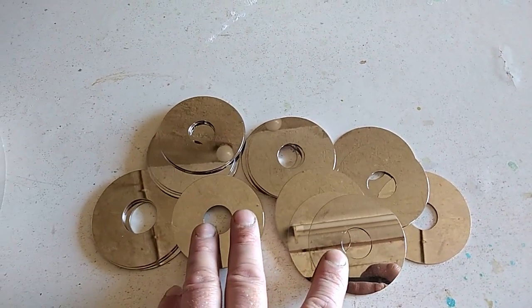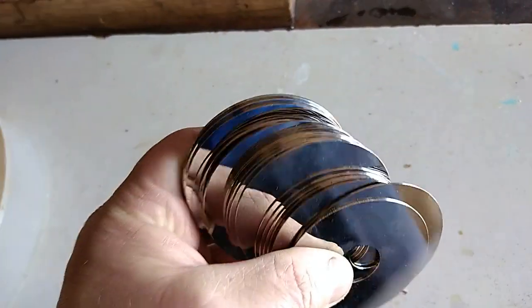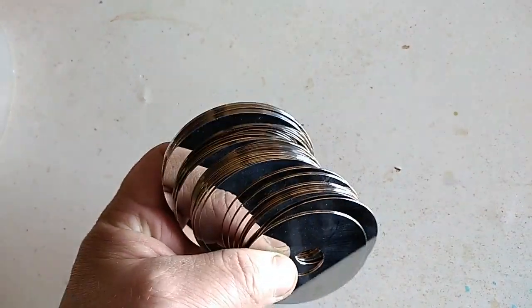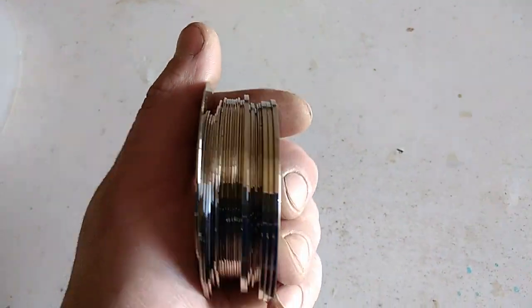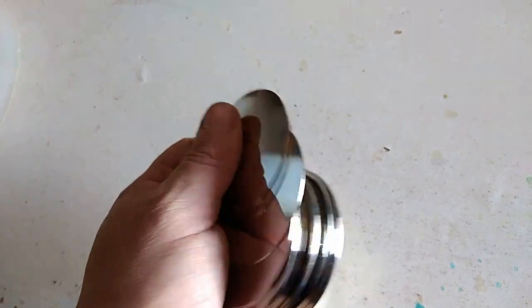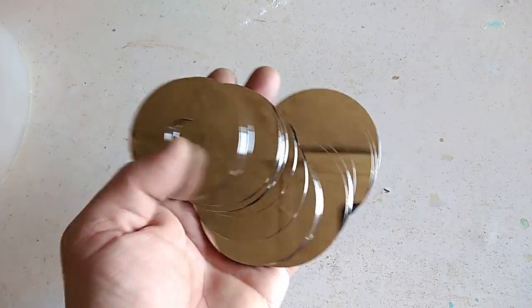I'll add some nitric acid first. So here I have 25 pieces of laptop hard drive plates. Three or four of them are thicker, so those are probably aluminum, and the rest are probably glass. Let's prepare that for the process.